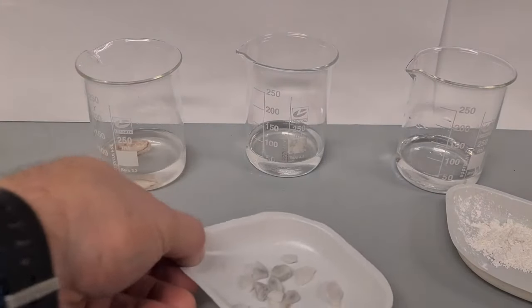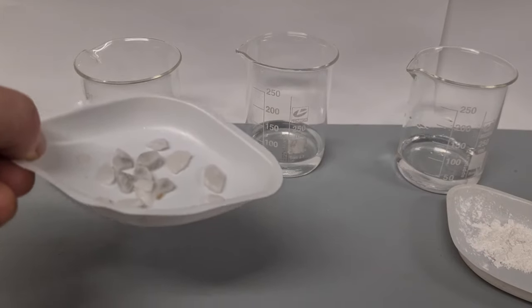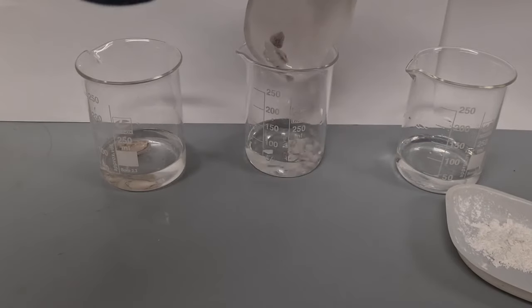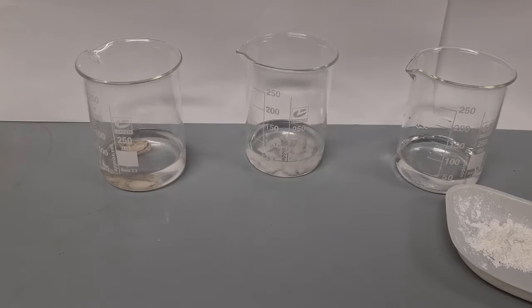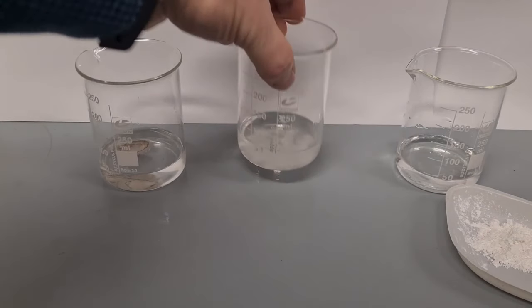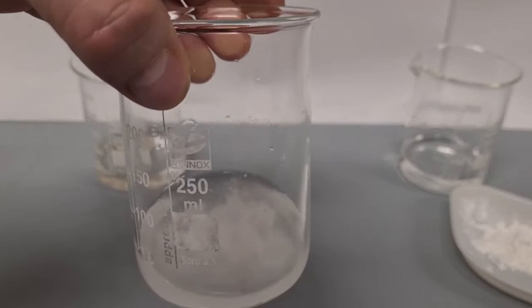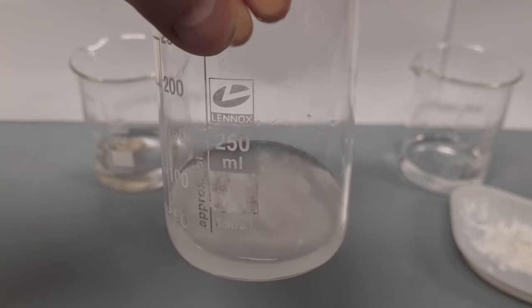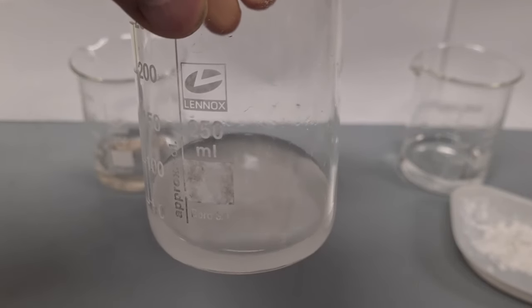If I add in the medium sized pieces of calcium carbonate, straight away I can hear there's more fizzing. I can see more bubbles of carbon dioxide gas being produced.